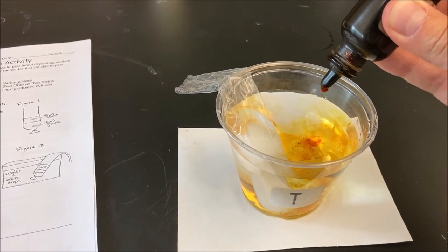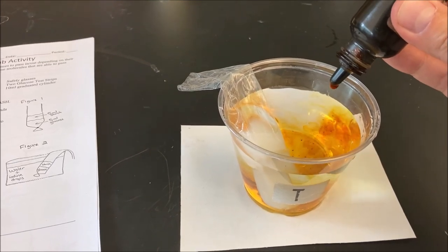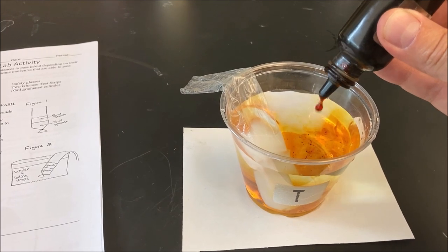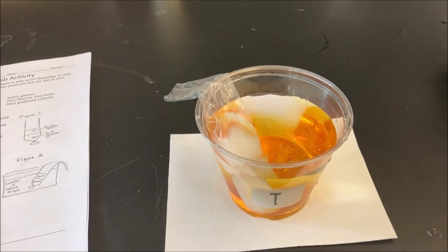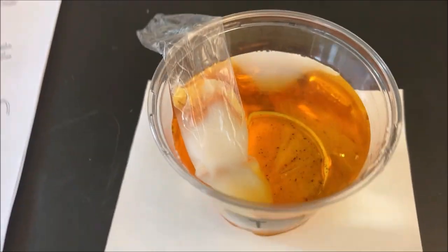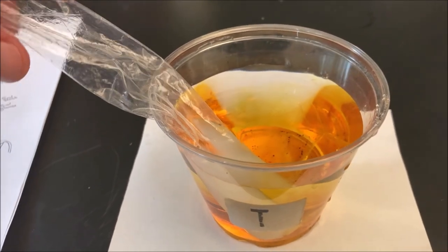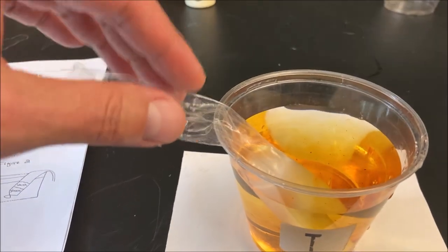Continuing to count drops — getting to around 17 or so, with a big drop in there. That's probably good. We're still going to get the desired results. So the cup is filled with a mixture of iodine and water, and the dialysis bag contains a mixture of glucose and starch.